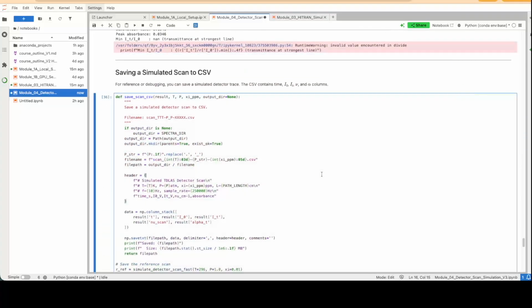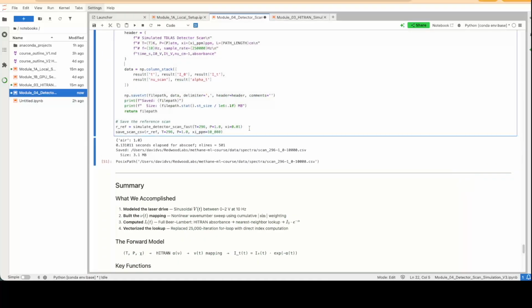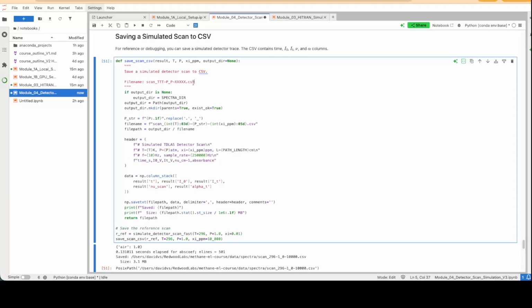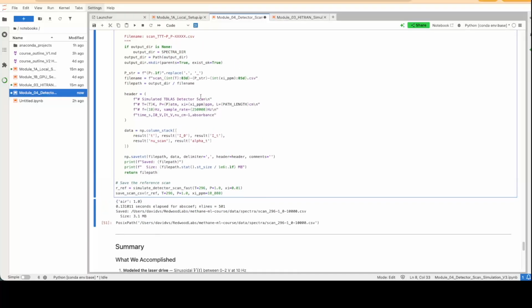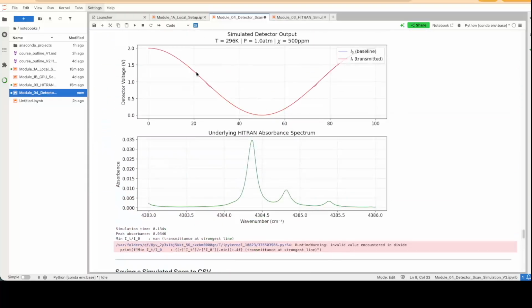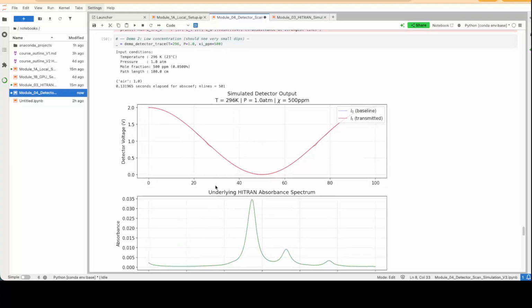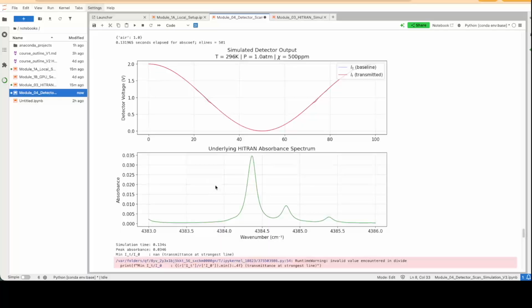What you can do, similar to module 3, is save this as a CSV file with our format here that contains the temperature, pressure, and mole fraction. This is really going to be the foundation of this data set generation. It's going to be essentially vectors of this transmitted intensity versus time, and we'll start stacking those up to a million to use as a training set for the model.